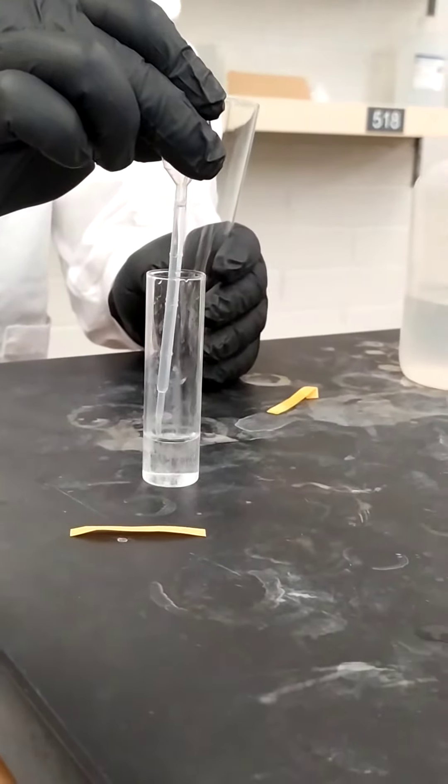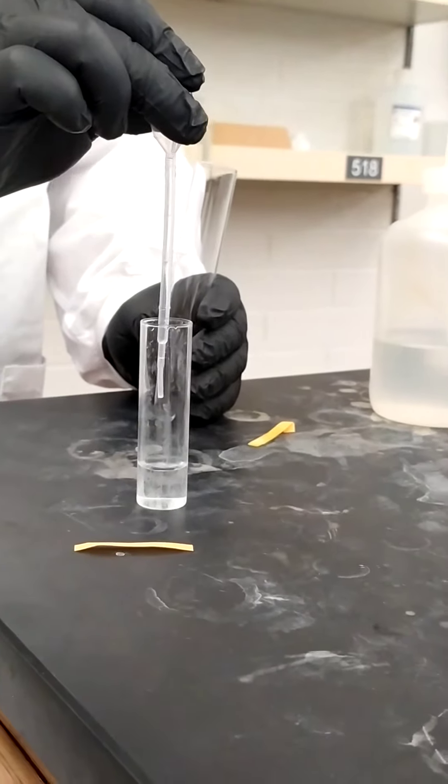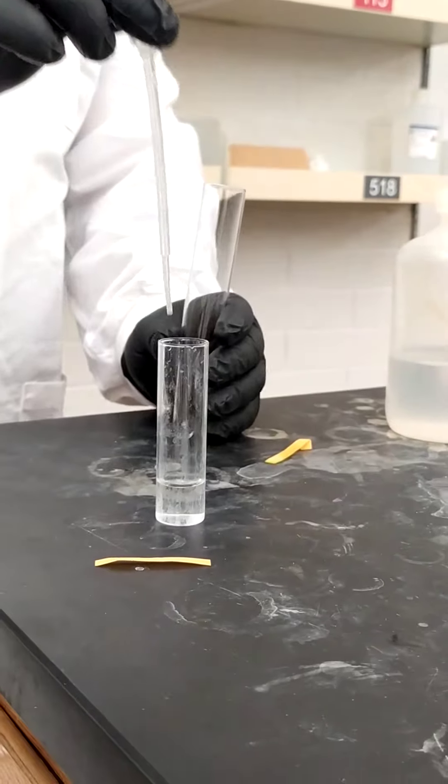Once we're at that line, we're going to maintain pressure so that it's level and we're going to exit. And there we have it. One milliliter.